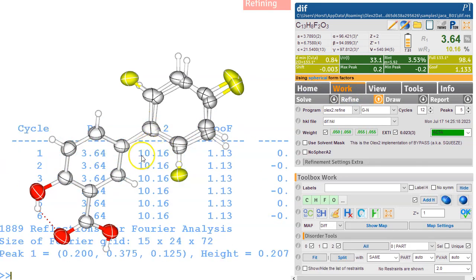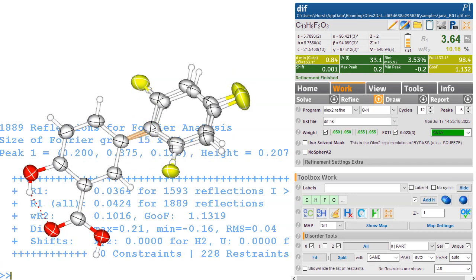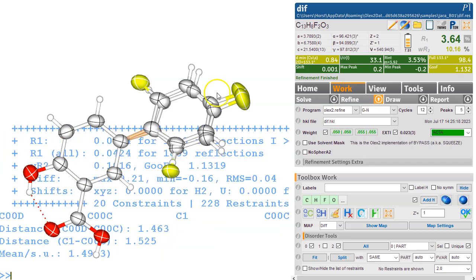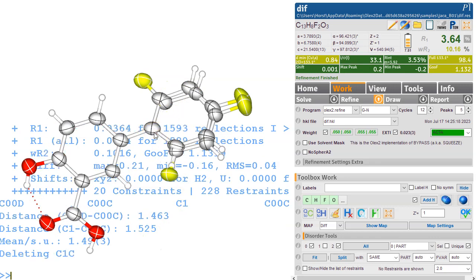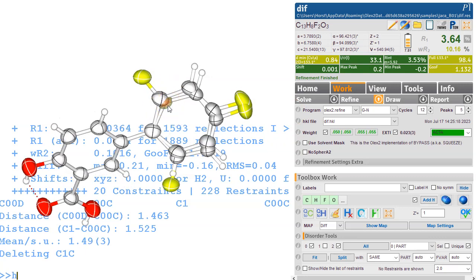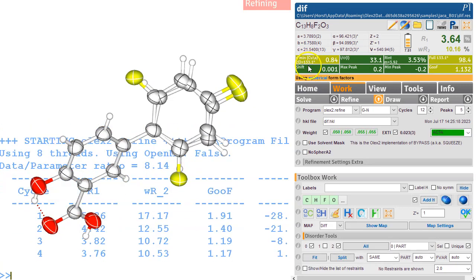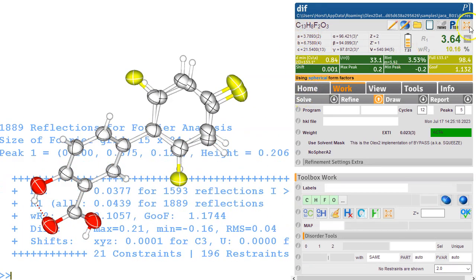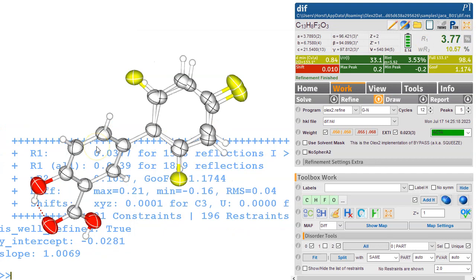Of course, we now may end up with funny angles here, so those two are very, very close together. sel -l. Okay, so this is 1.46, 1.52. I suspect the way to go about this is to select them and make this part 0 1 1, so I just have one. It deleted a hydrogen here because it didn't like the connectivity after delete, and presumably now that one's still fine. And refine that again and see what we end up with. 3.77. I think that's acceptable. That looks fine. Control R.